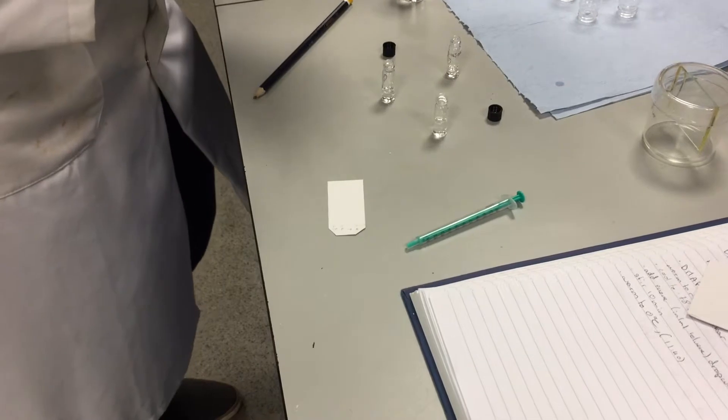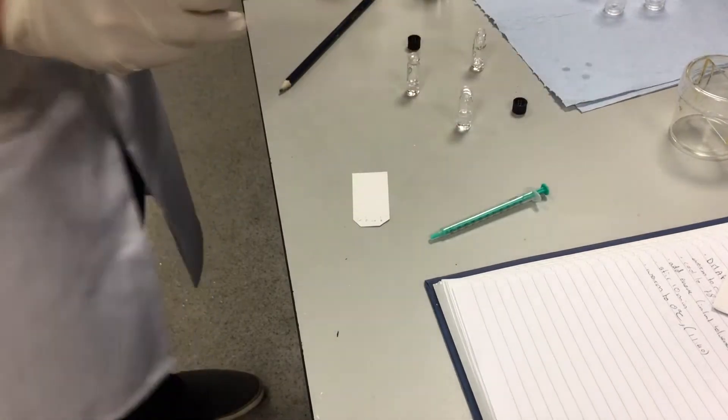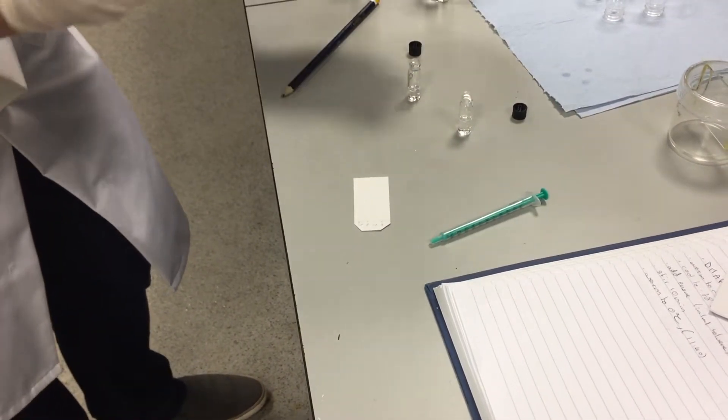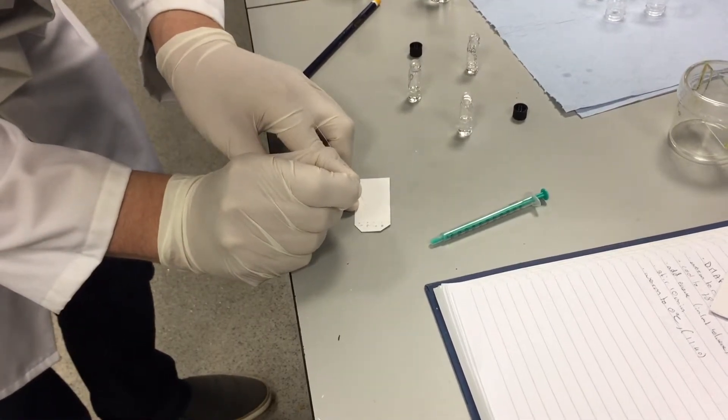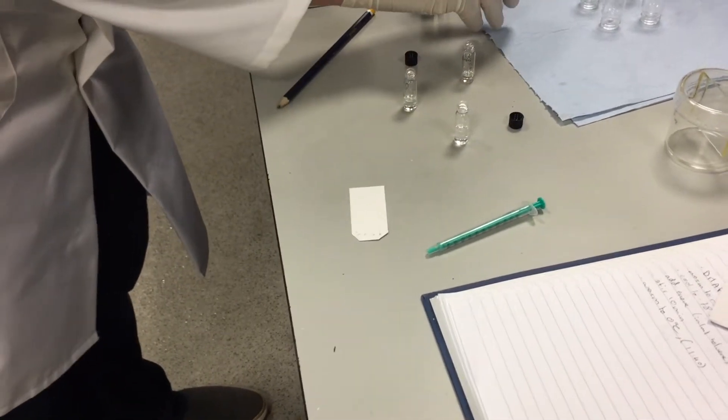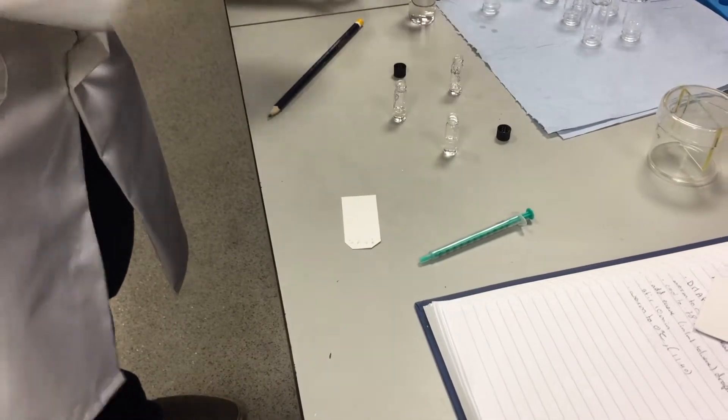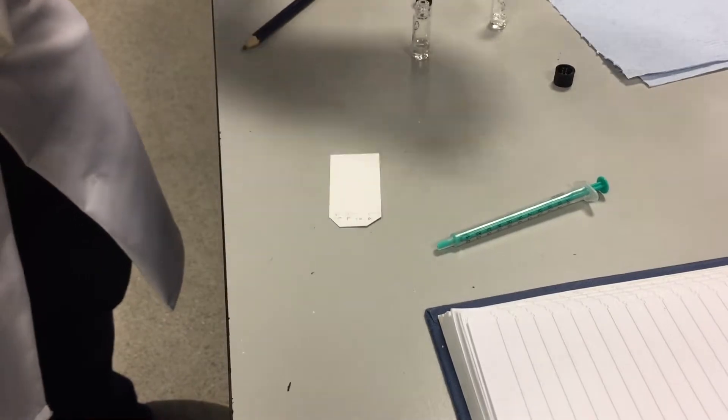And then wash the capillary in between each spot and do the same for all of our samples. And finally our reaction mixture.